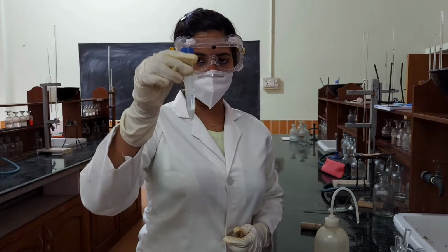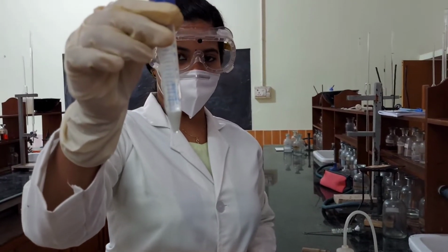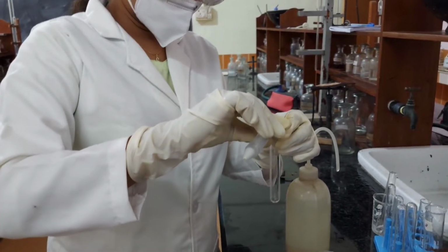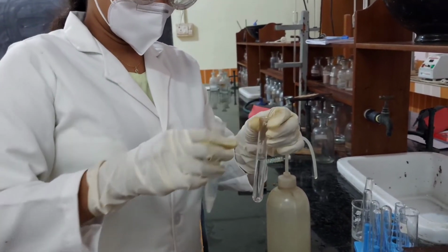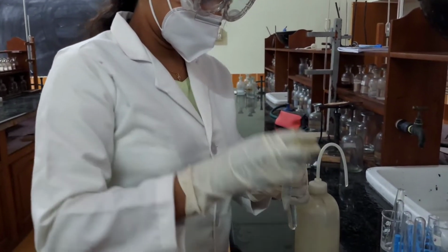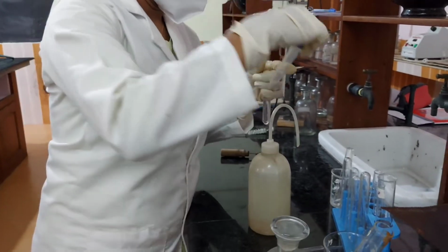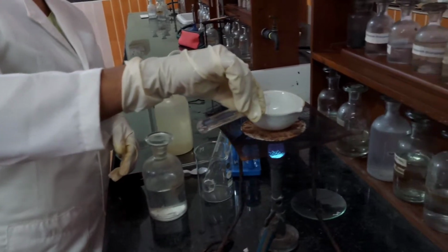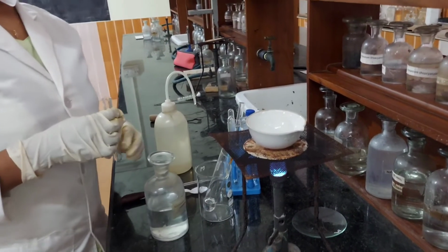The residue is then centrifuged. The centrifugate is taken for the analysis of group 5 and the dirty white precipitate is kept aside for the confirmatory analysis of group 4 cations. The centrifugate is then concentrated and thus H2S is boiled off.